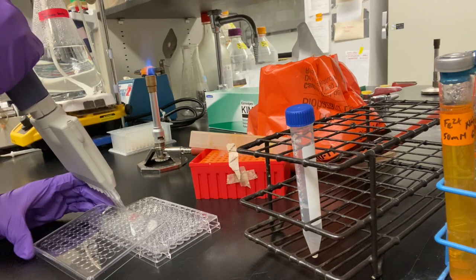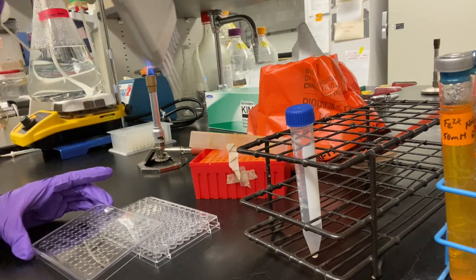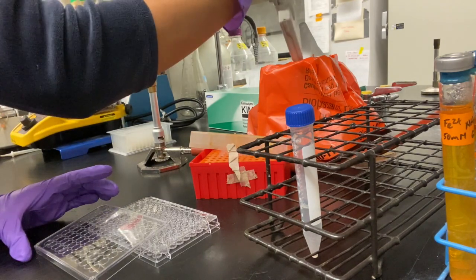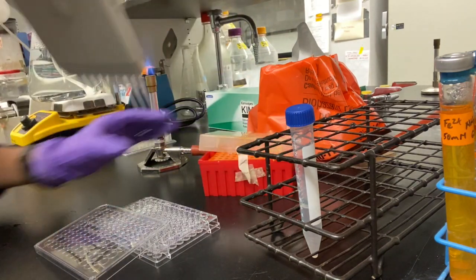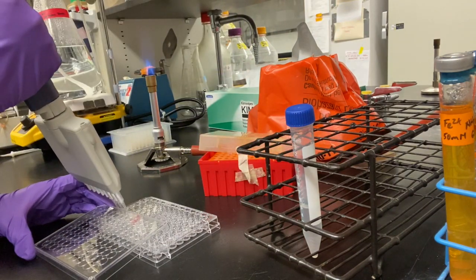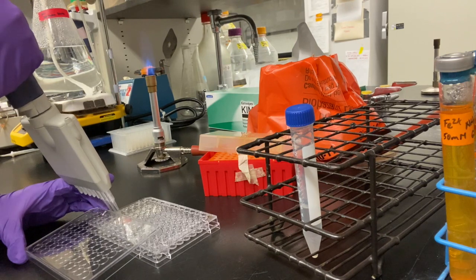Since serial dilutions are concentration dependent, disposal of tips between rows is mandatory. The lid of the microtiter plate can be used as a marker to indicate which row you are working on. Be sure to be diligent and not lose track of which row you have transferred your serial dilution into.